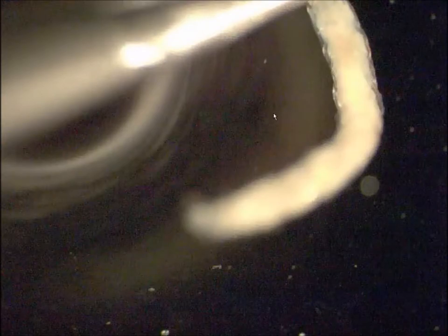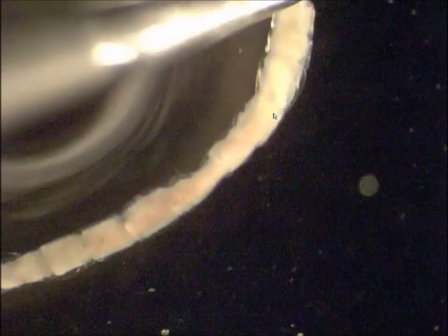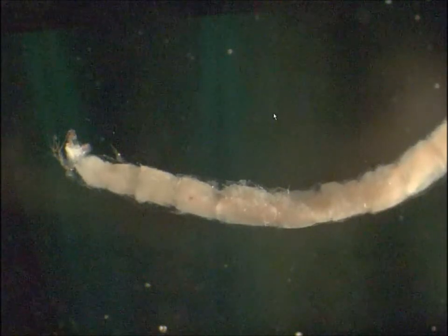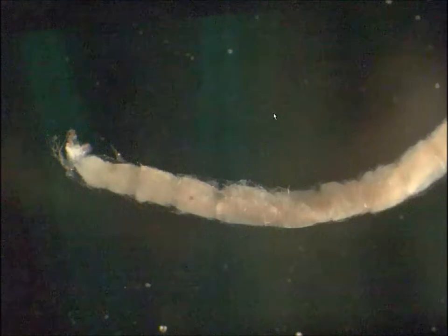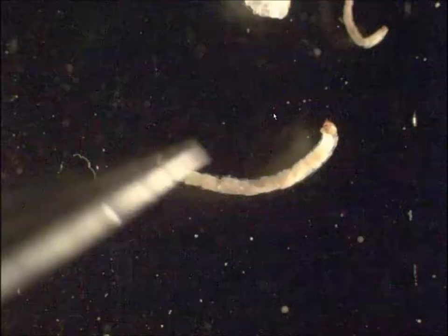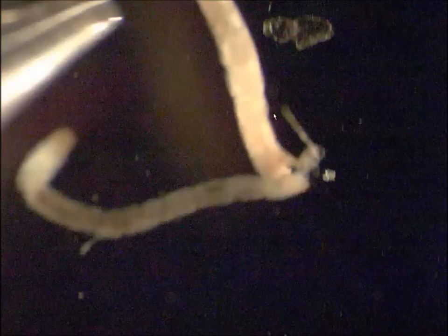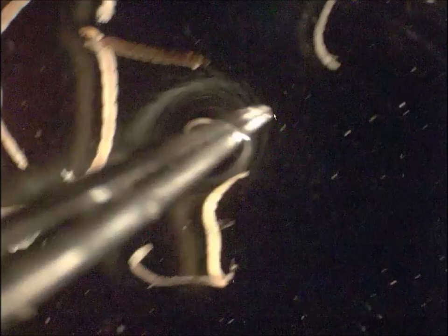A chat question came in: are the segments more deeply pronounced in Tanytarsini? Yes, the intersegmental pinching does seem a little more pronounced on Tanytarsini than on Chironomini — that's just a general impression but a useful one.